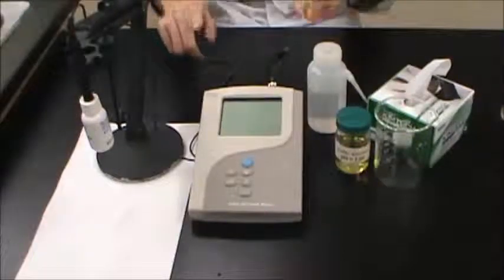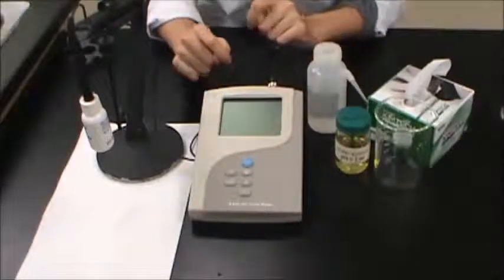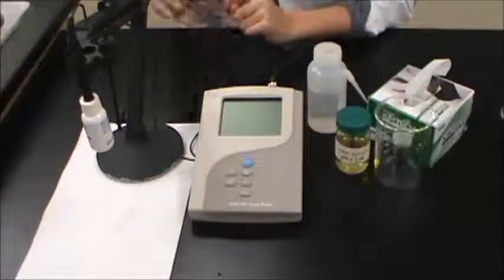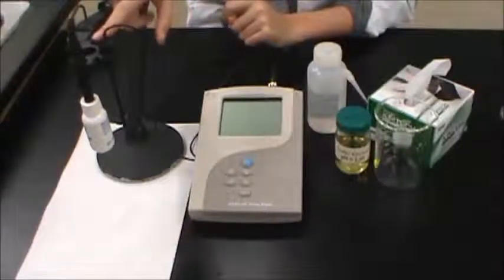This is the instructional video for a one-point calibration of a Beckman pH meter. Before you begin, make sure you have the following items.